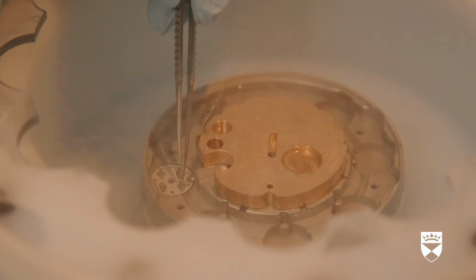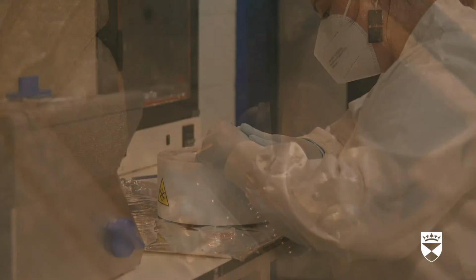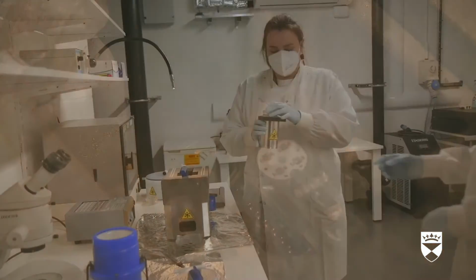In full PPE, the scientist pours liquid nitrogen into a large container with the sample. Gas billows up. Another scientist moves the frozen sample into a smaller canister and passes it to the first scientist. He places it into a compartment on the side of the microscope. The proteins in the solution stick to the mesh and are frozen rapidly.